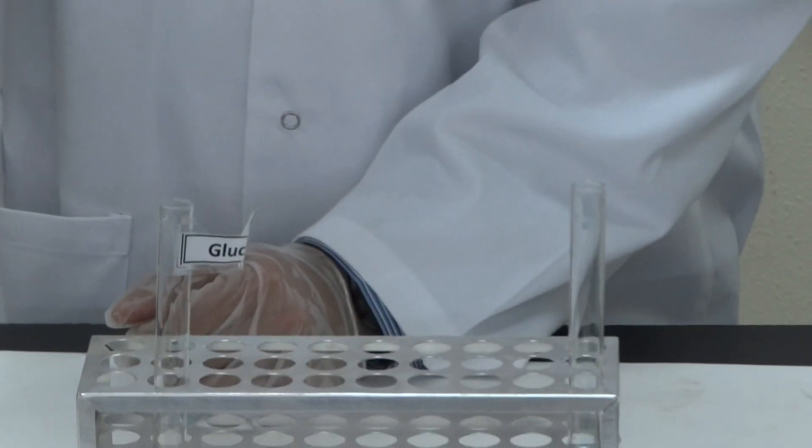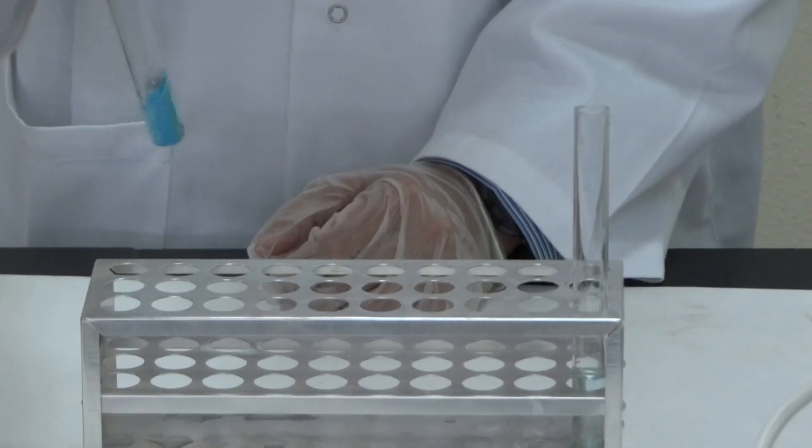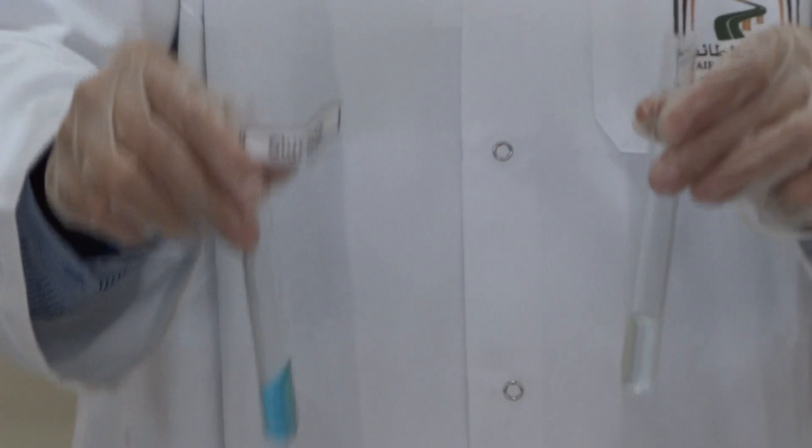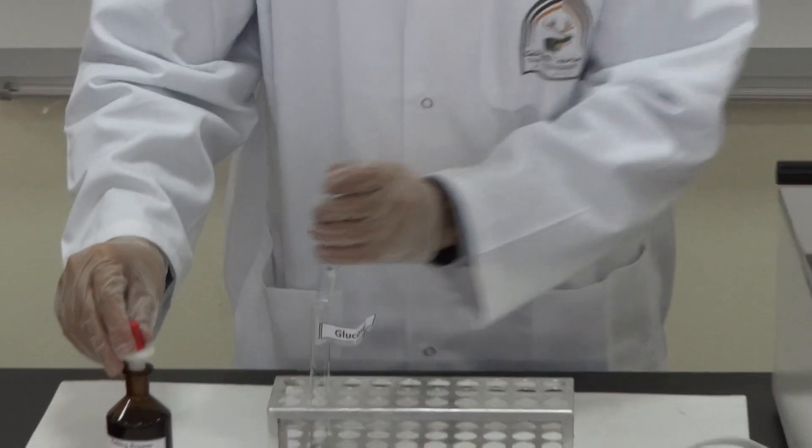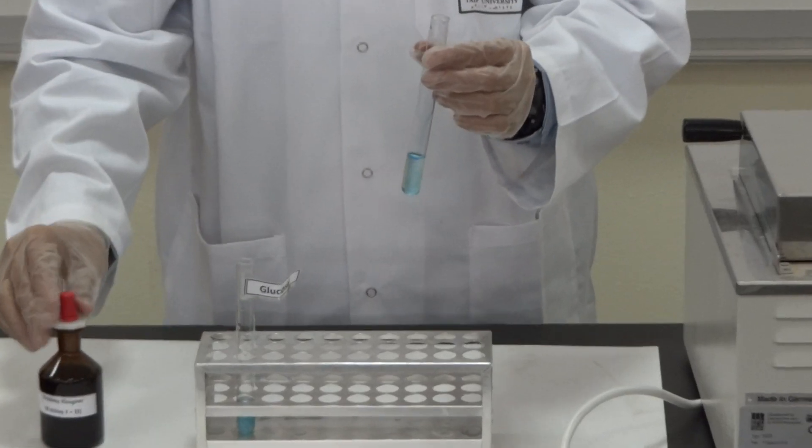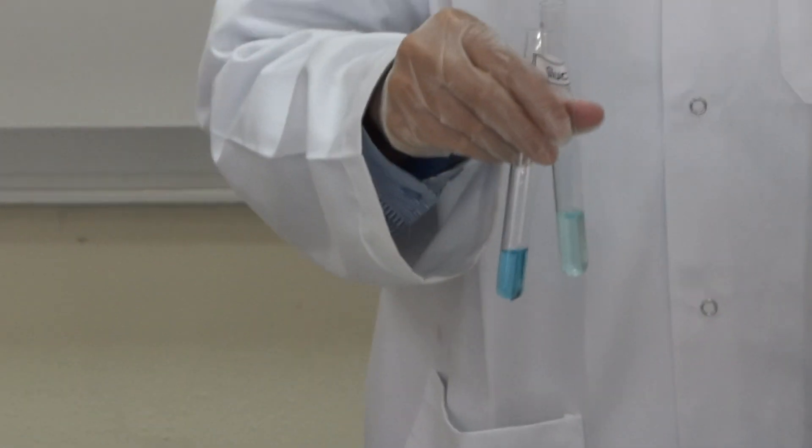Finish this too. Mix well. Mix well. Maybe we need a bit more. And then take both of them.